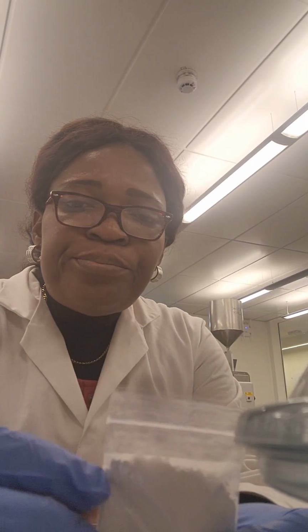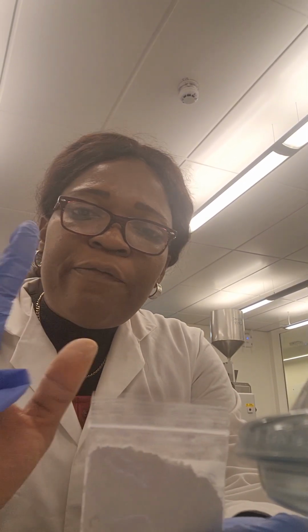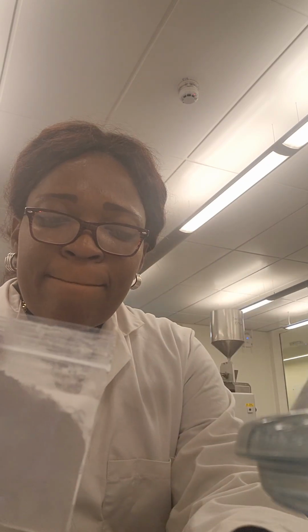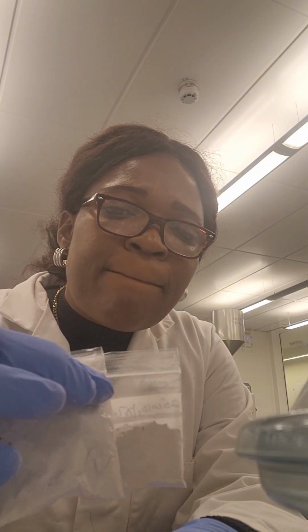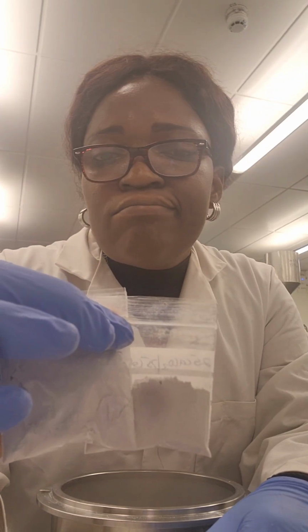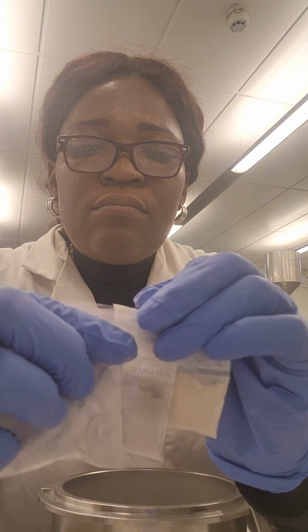and looking at internal things that happen before we see our window glasses, before we see the glass cups we use in the kitchen, or glass bottles we use to take our beers and other drinks. We use them for packaging. This is the process they undergo, but this is just the lab scale. You see that? Yeah, 1100 and 1000.